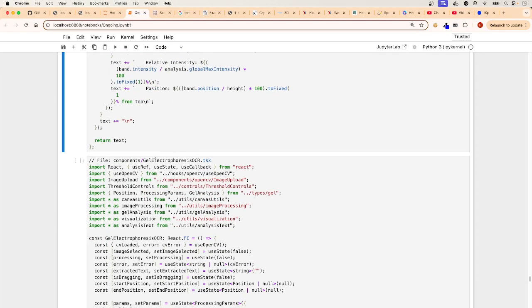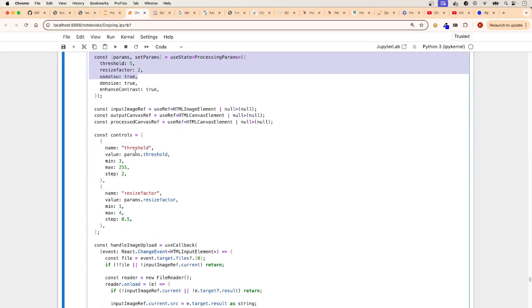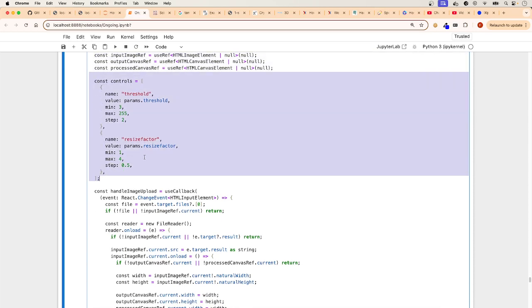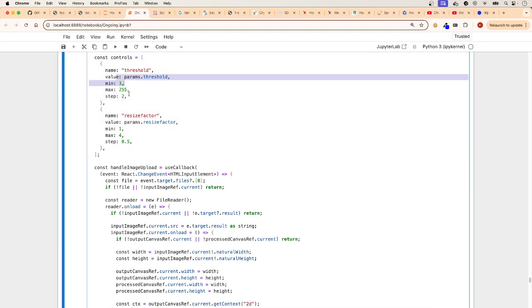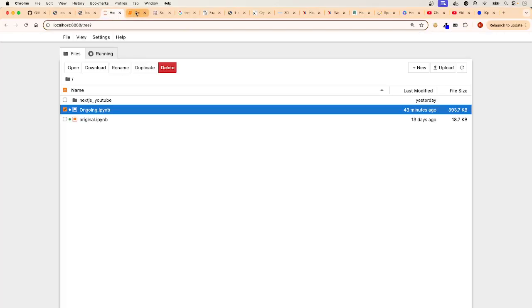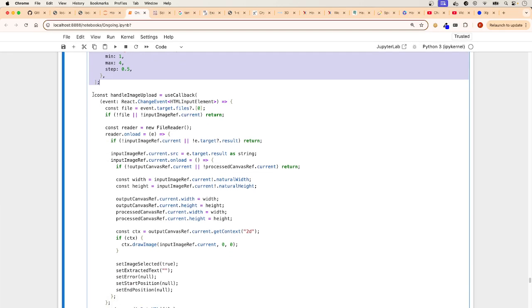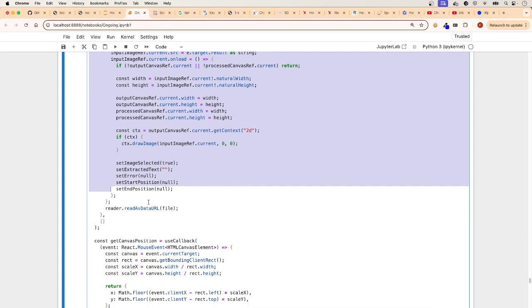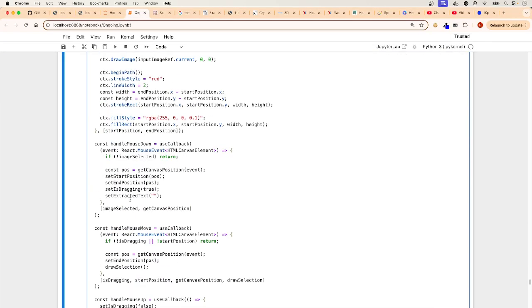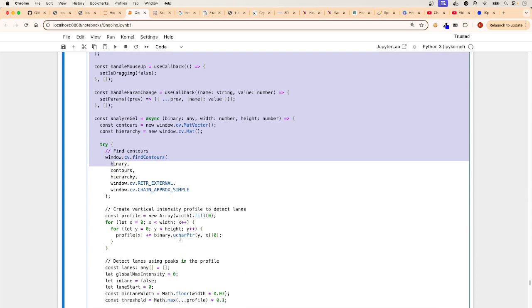So now we go into the next one. And this is the big one because this one takes all of the files that we've done. Remember the references to the DOM, the threshold controls for the initial values. If you want to make it more optimized, you can change those here. This is where you will change them to make them more optimized. This is taking the image upload. We've done this a million times in the other tutorials, so I'm not going to go repeating myself because you've already seen it. If you haven't seen it, watch my previous tutorials.